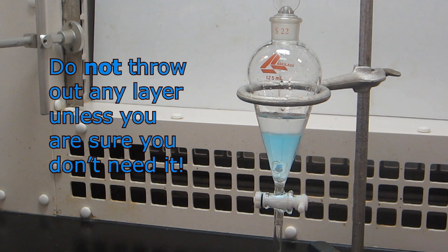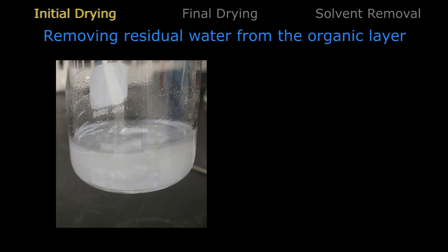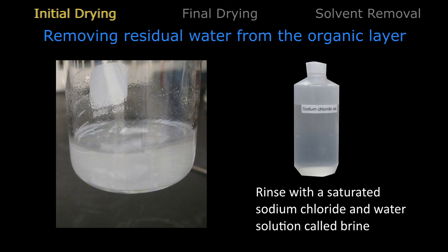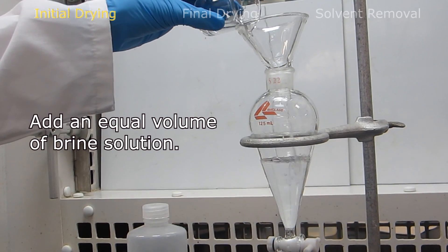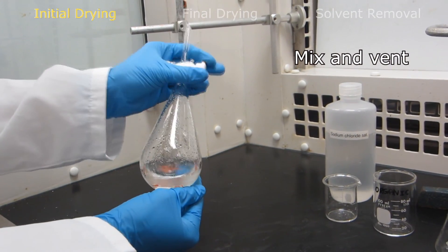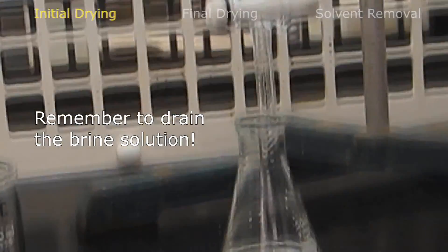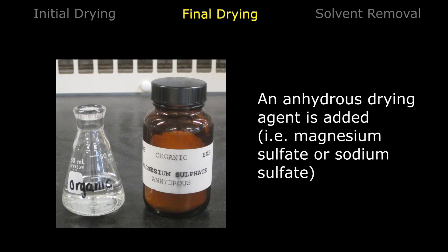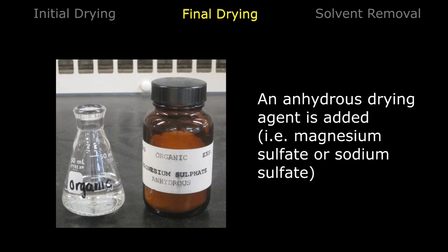Do not throw out any layer unless you are sure you don't need it. Now that we have extracted our product, we need to remove any solvents from the mixture. Many organic solvents contain residual water. To remove the bulk of the water from the organic layer, it is rinsed with a saturated sodium chloride and water solution called brine. Add an equal volume of brine solution into the separatory funnel containing the product solution. After performing the mix and vent technique, the excess water in the organic layer migrates over to the aqueous layer to establish equilibrium. Once this is done, transfer the organic layer into a clean and dry flask. To remove any remaining water from the organic solution, an anhydrous drying agent is added, such as magnesium sulfate or sodium sulfate. In this example, magnesium sulfate will be used.